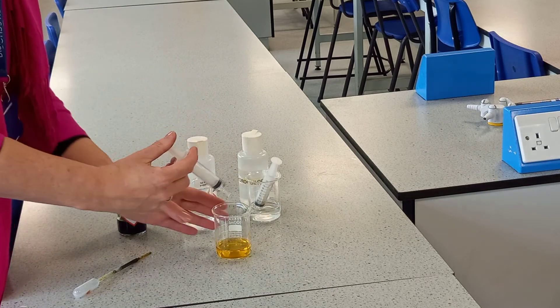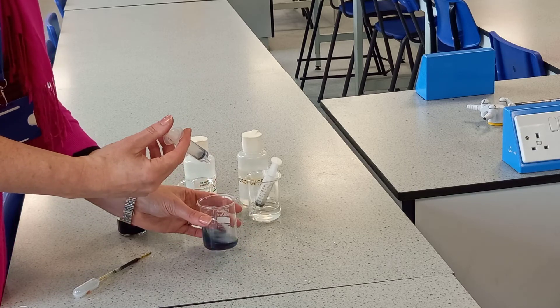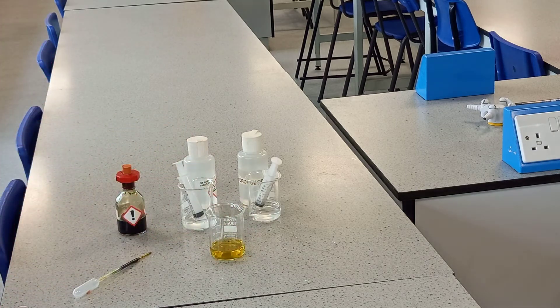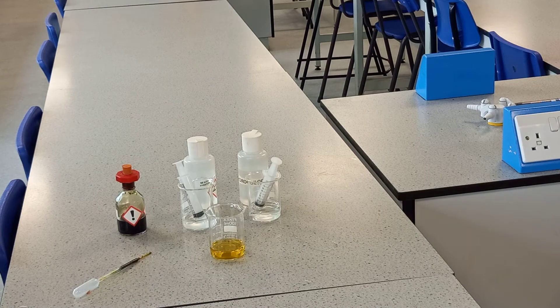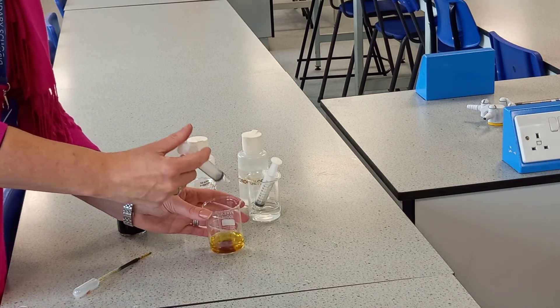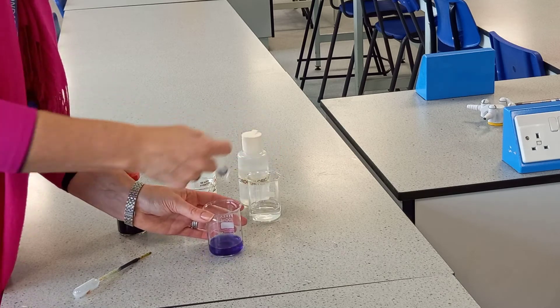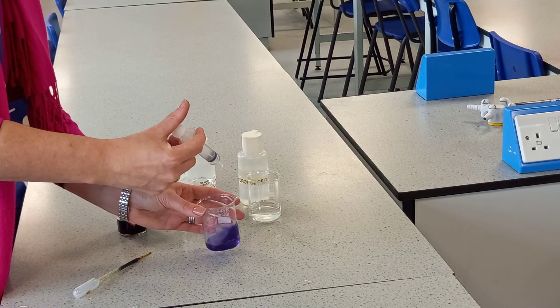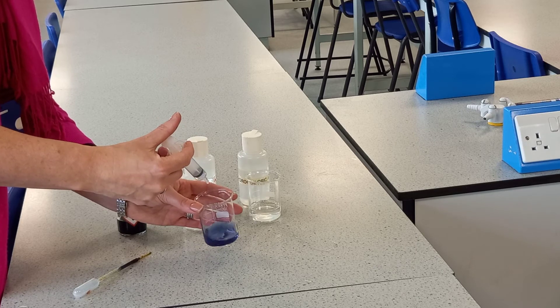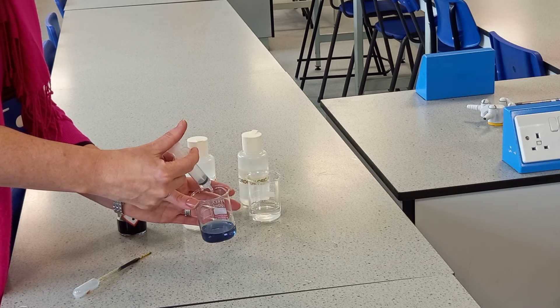So this is a very, very delicate situation where you have to add it drop-wise. And there you can see it was green and it's now gone yellow. This process can sometimes take a few attempts in order to make a neutral solution.